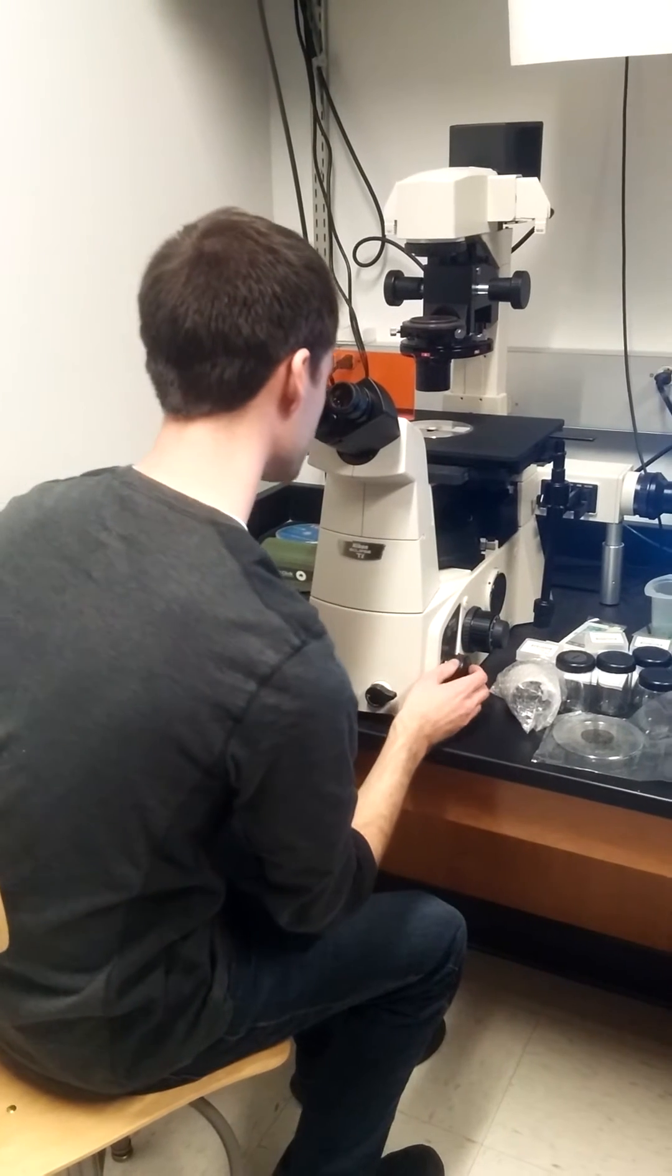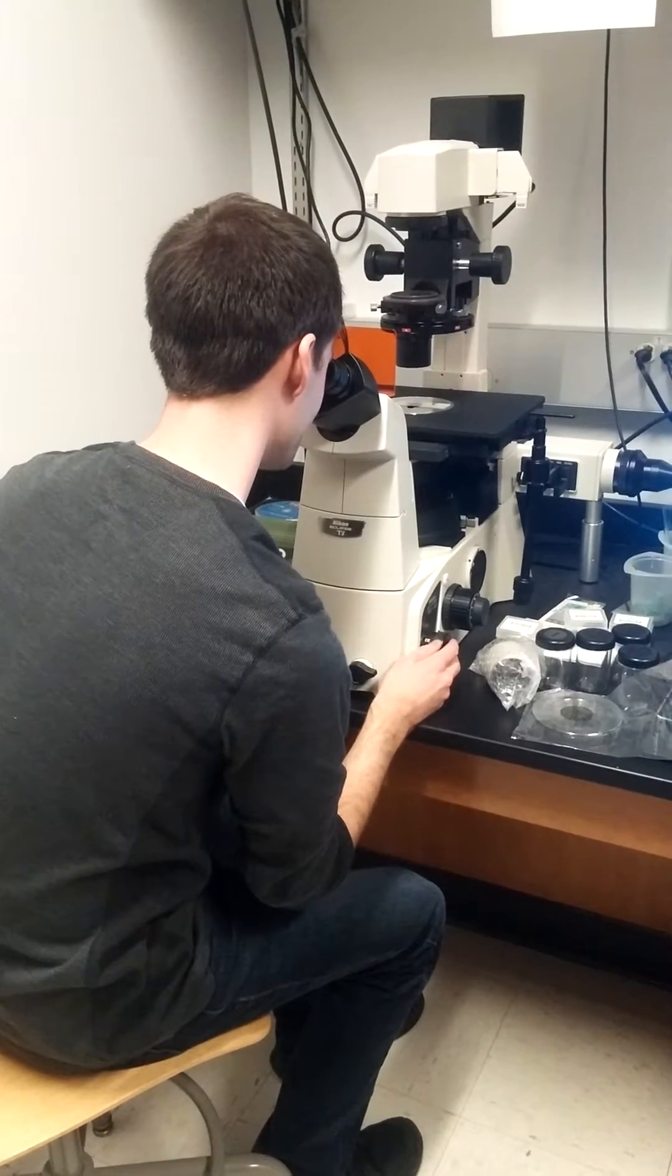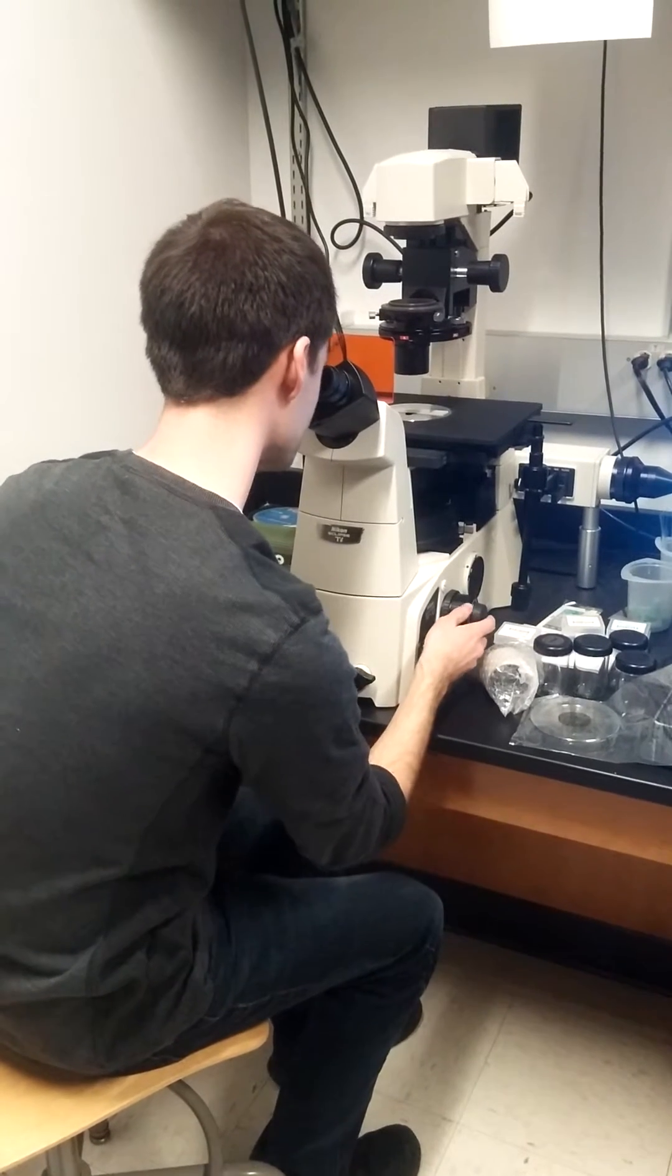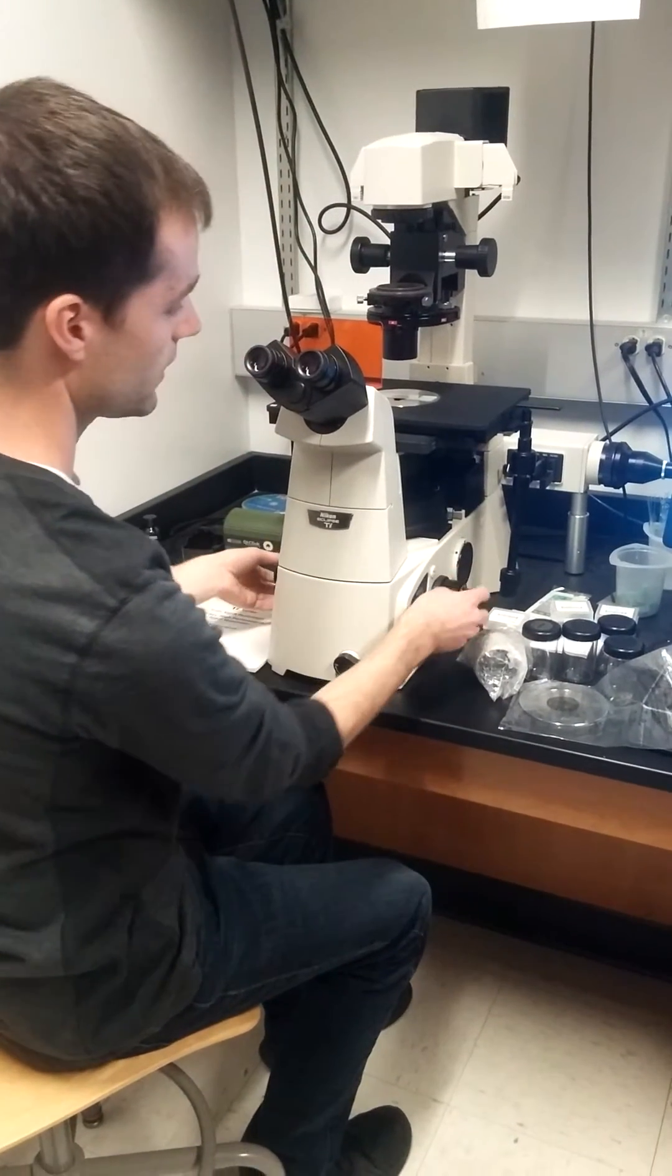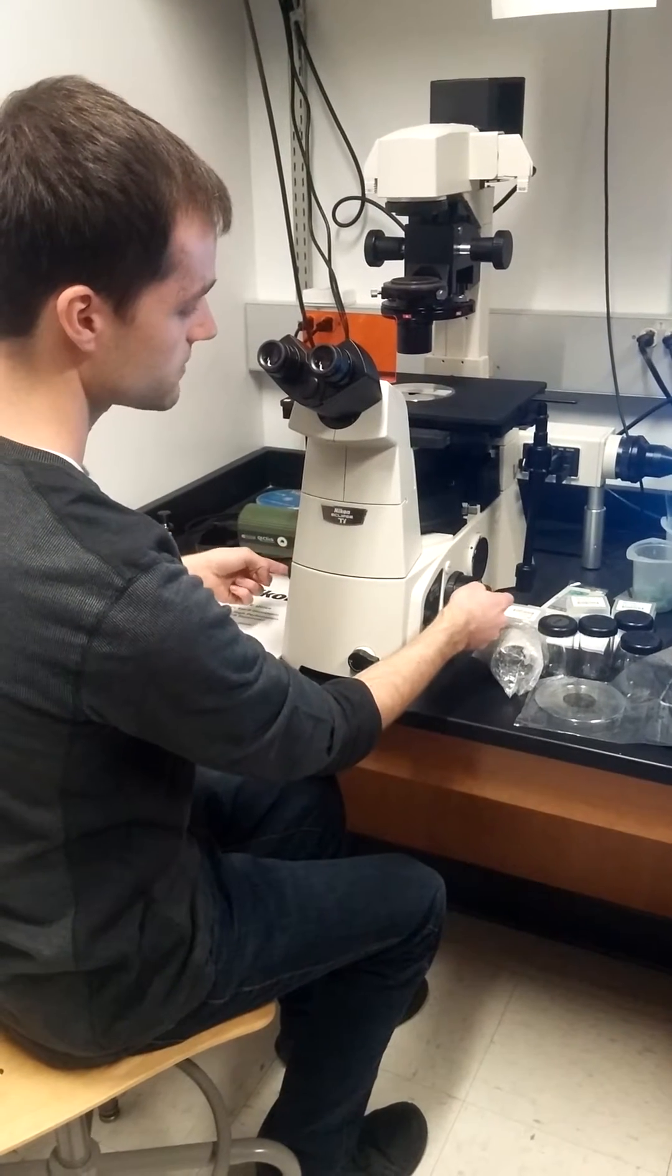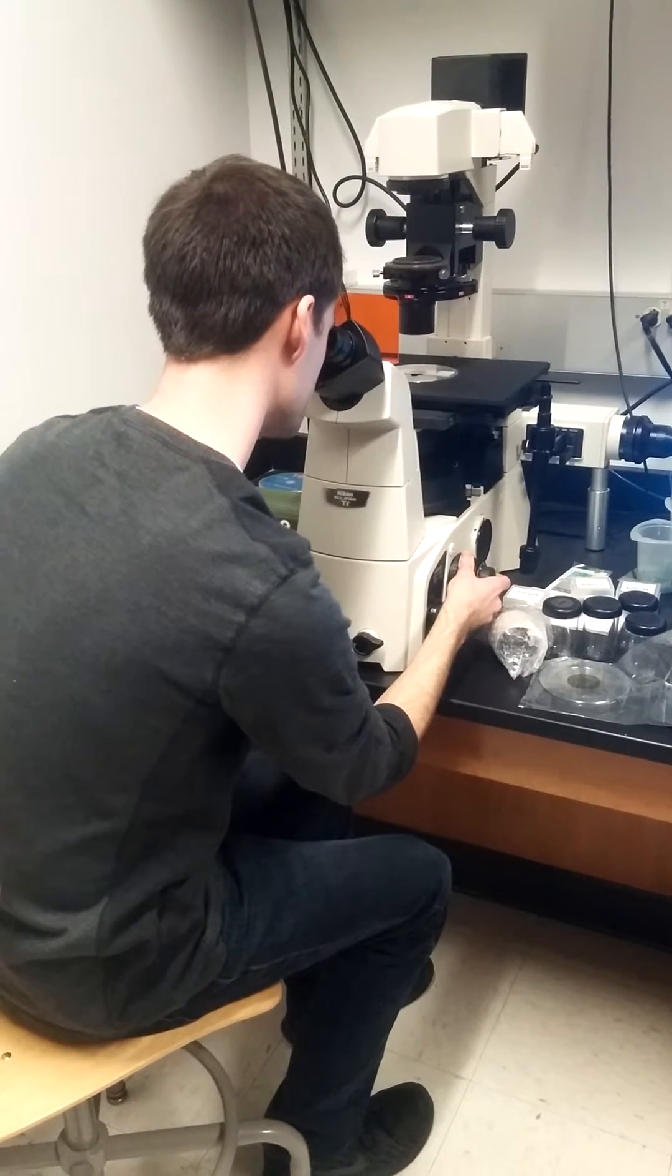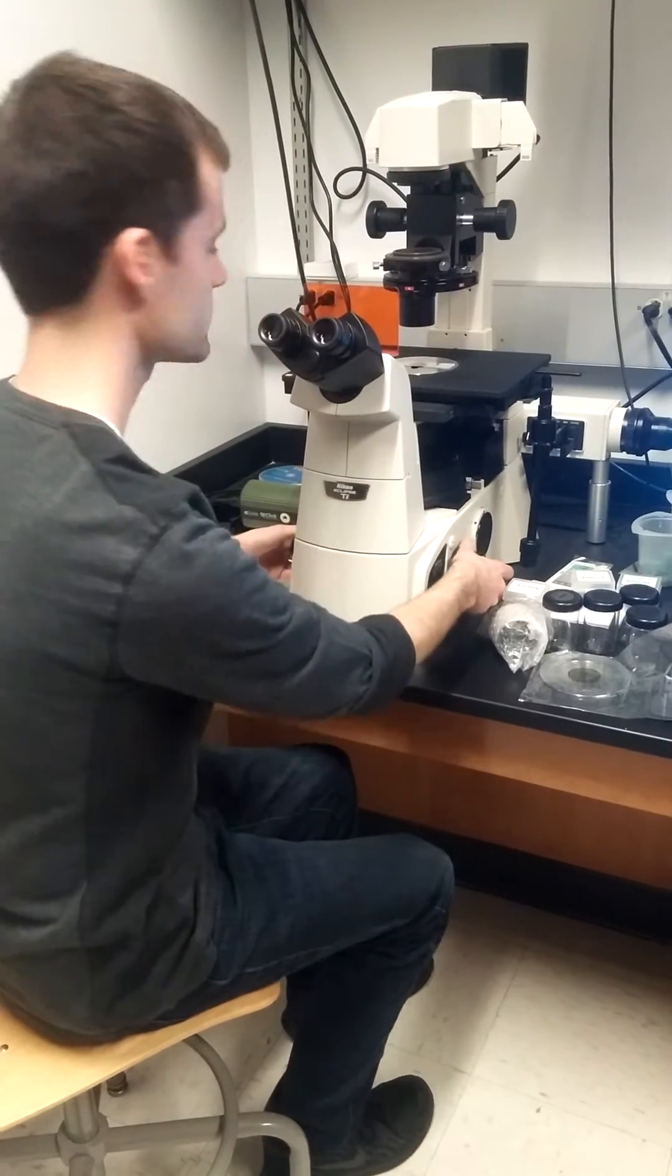So let's look at what we have. I'm going to adjust the lighting so it's not blinding me. And then use the coarse and fine adjustments to focus on our image. Starting with the coarse, of course.